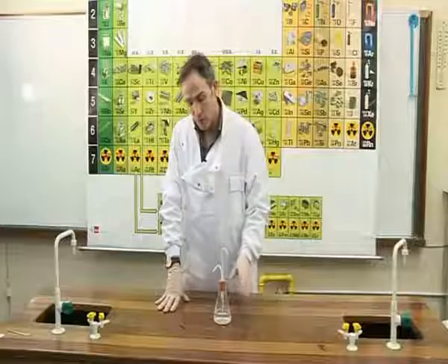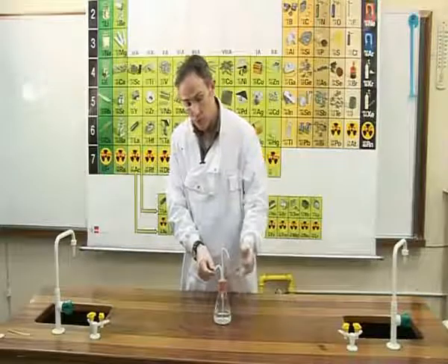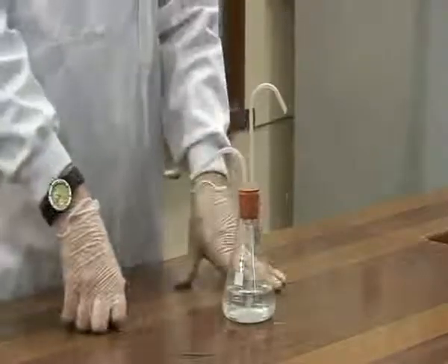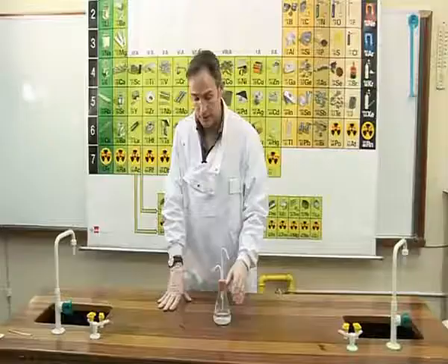What we will do is suck on this pipe, or inhale on this pipe, which causes carbon dioxide and normal air to get sucked in through the other pipe. This will cause the lime water to change colour from clear to milky.